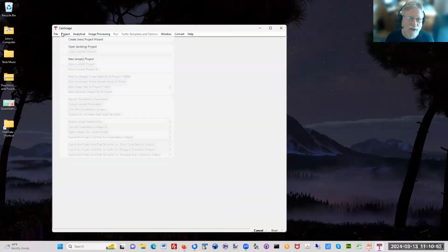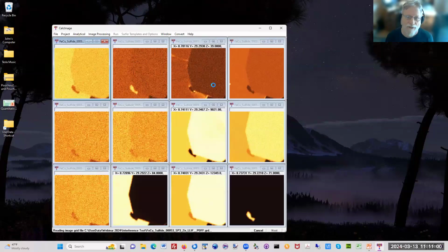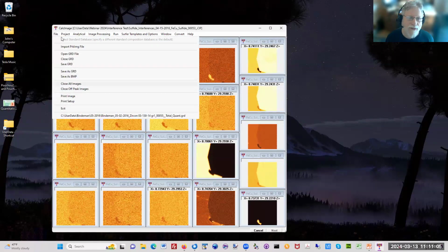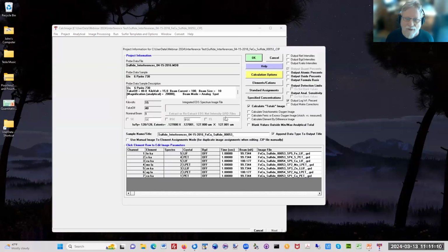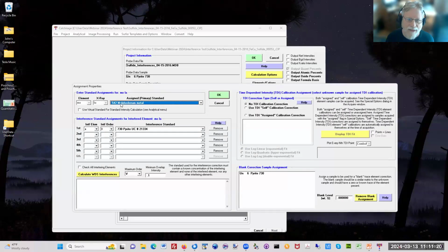and apply the interference correction, which, by the way, can be specified in Probe for EPMA ahead of time, or you can just do it in the program here. I'll show you that. So here's the close all the images, and I'm going to go to the assignments here, go to standard assignments. This is the same dialog box that's in Probe for EPMA, and I'll click on molybdenum here, and you can see that we've said that this is the molybdenum standard, it's molybdenum metal, and we're saying the interference correction is pyrite for sulfur, and it's a first order interference.